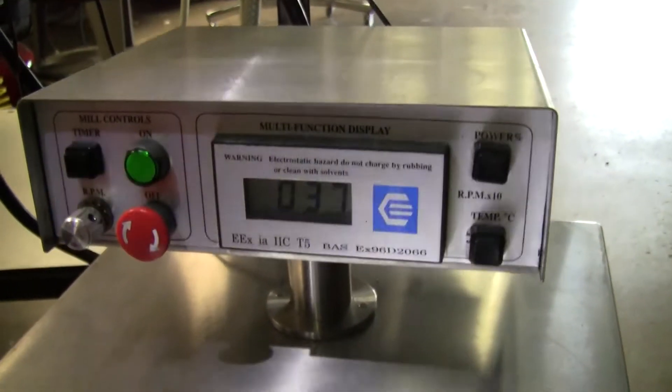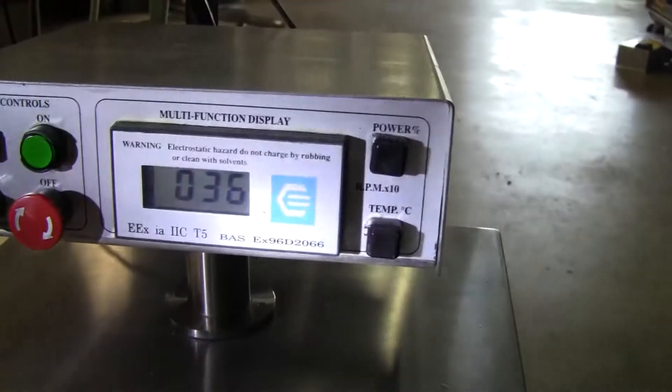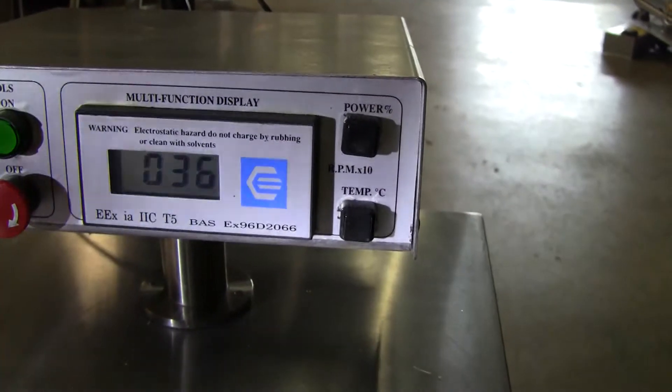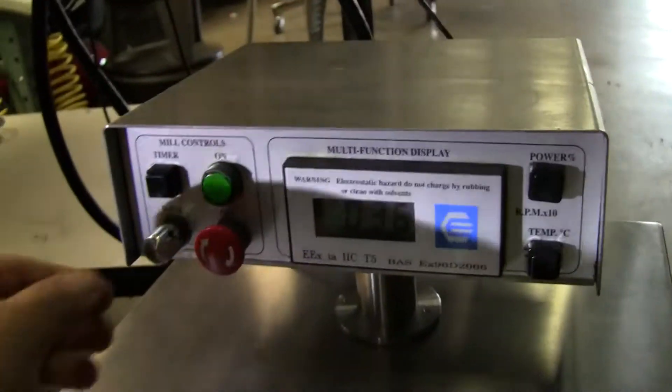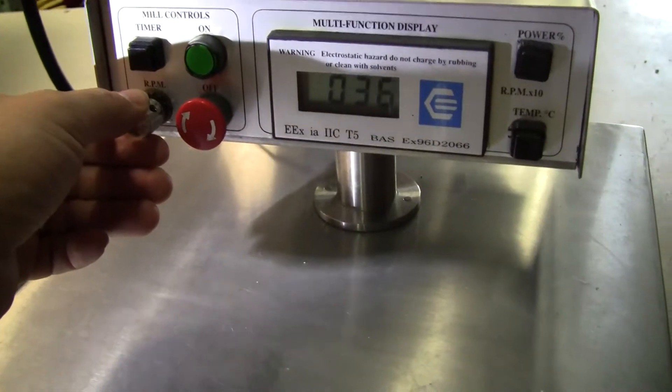Control panel. Multi-functional display they call it. RPM. I'm going to now change the RPMs.